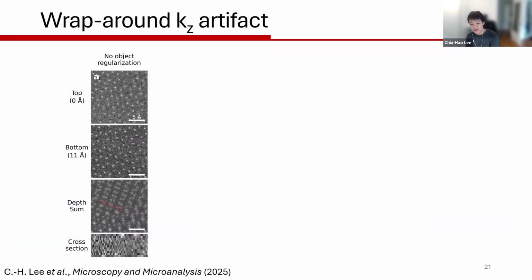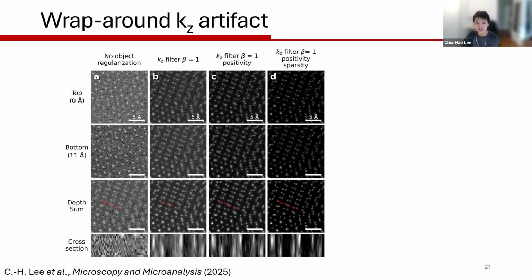Another common artifact, which I believe most people have probably encountered, is a wraparound artifact in the Z dimension. Back in 2021, when we were doing multi-slice electron ptychography, we had to apply the so-called missing wedge regularization, or the KZ or arctangent regularization. Essentially, it is clipping, removing the KZ information in the object Fourier transform. If you don't do that, you don't actually get a reconstruction done, so everything is very noisy. If you start applying this KZ filter, you start getting something reasonable.